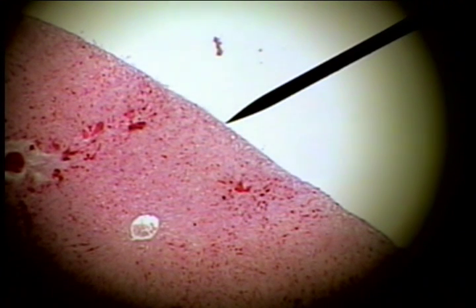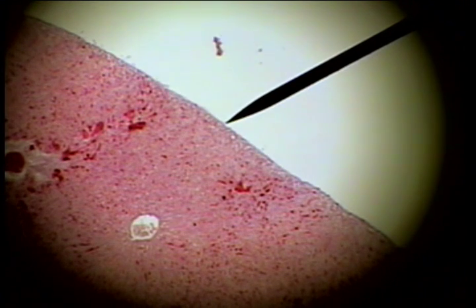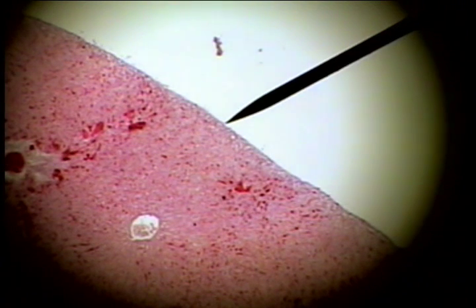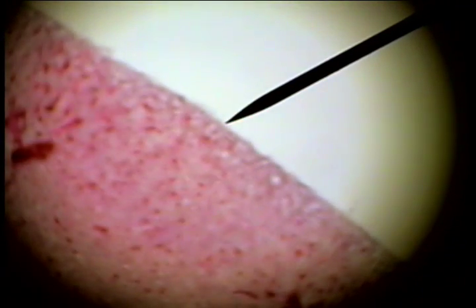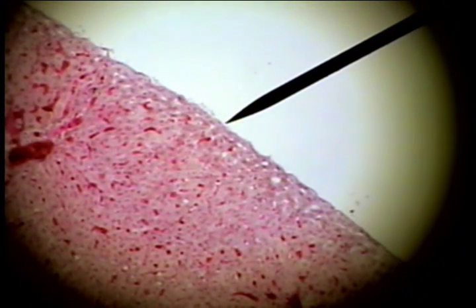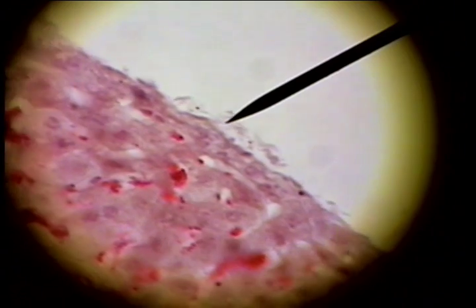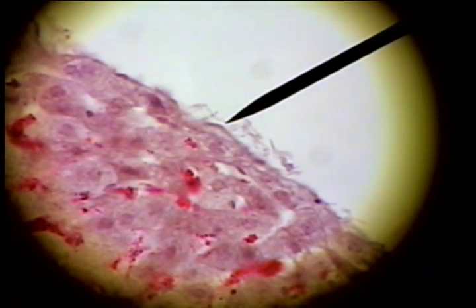The liver is a digestive system organ. It's an outgrowth of the digestive tube, and it does have a connective tissue capsule on the external surface. It may have fingers of connective tissue extending down into the substance of the liver, and those are called trabeculae. This dark line here would be the capsule.